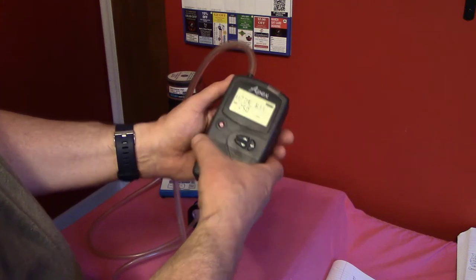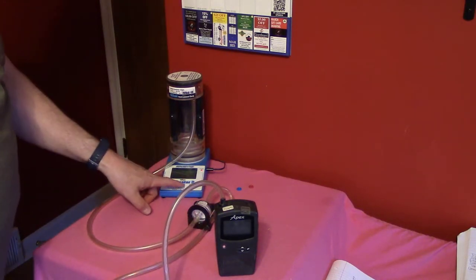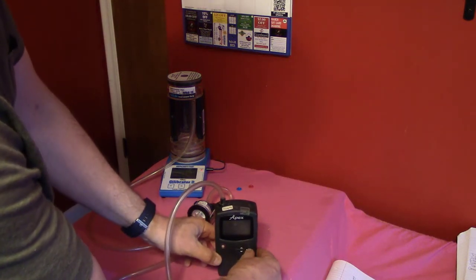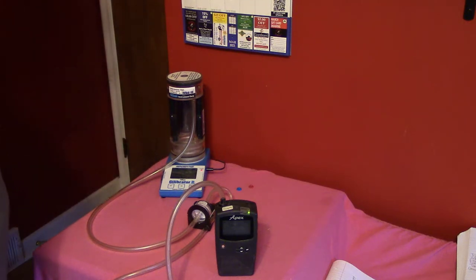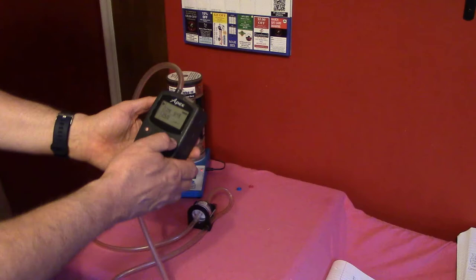I'm going to pause and set up the calibrator — I need to turn it on. It goes through a little setup routine and now it's ready. It will give me the flow for an individual reading as well as an average, and I can reset that average whenever I want. I turn the pump on and observe the bubble going up. The flow reads about 2.545 liters per minute — higher than the setting — so I need to lower the calibration flow on the pump.